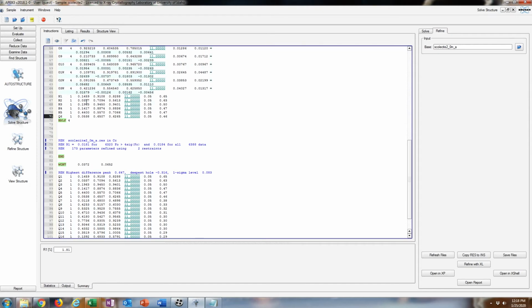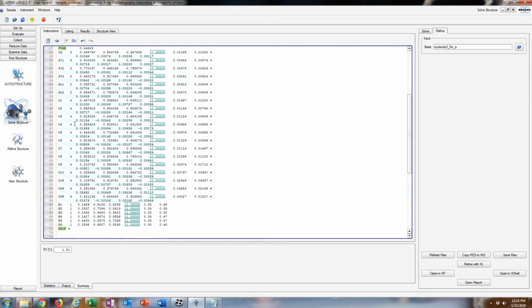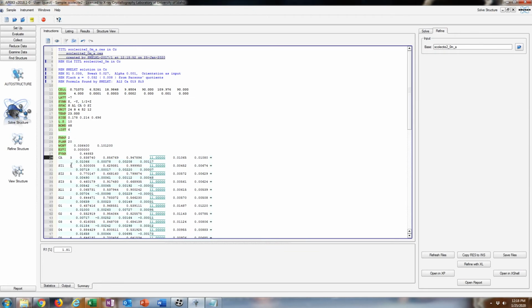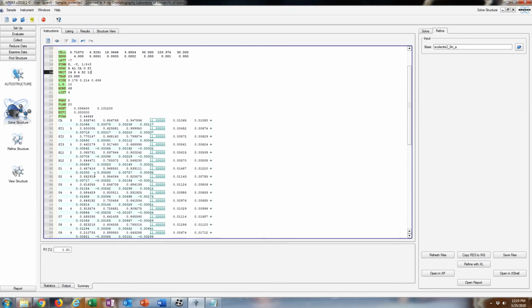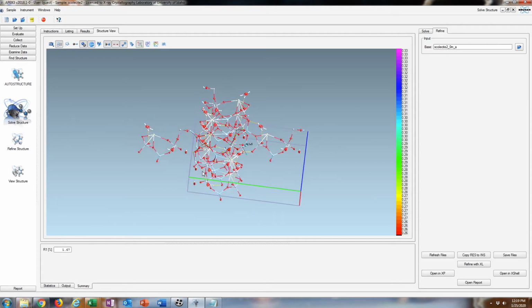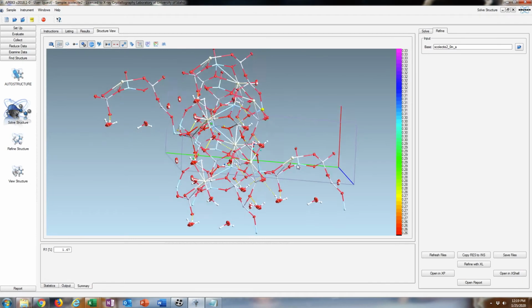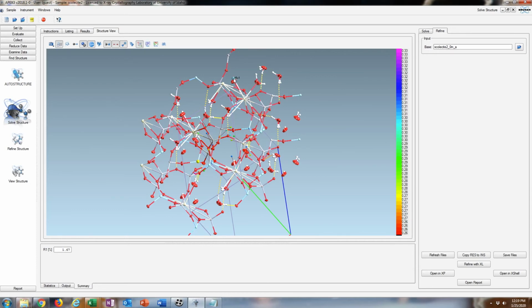That number 1, if I haven't explained this yet, goes with this scattering factor because it's the number 1 element listed there. So that is hydrogen. For example, calcium is number 3 because it's the 3rd listed here. Si is 5. So that's how it knows which scattering factor to use, or just for your purposes what element to use. And the naming can be just whatever. Okay, so that dropped things a bit here. We're down to 1.67. But of course, some of these hydrogens don't make sense, like that one. But it's looking pretty good, and the hydrogens are behaving really well.